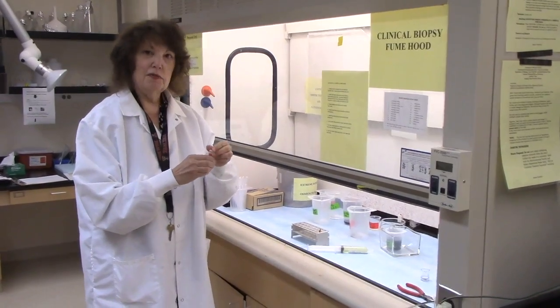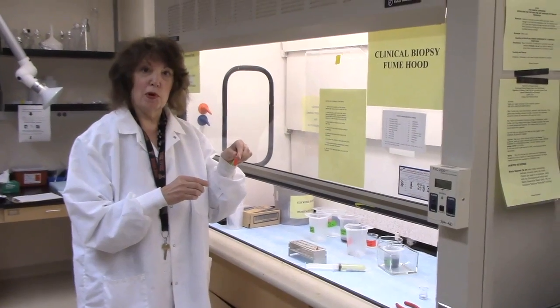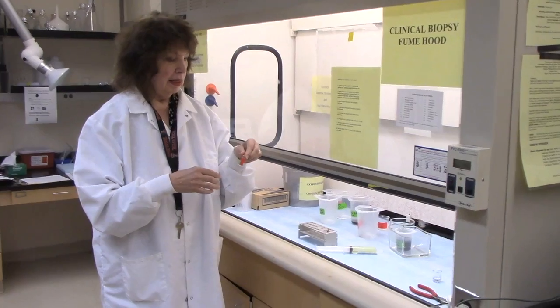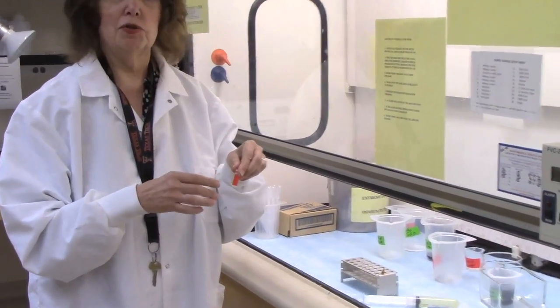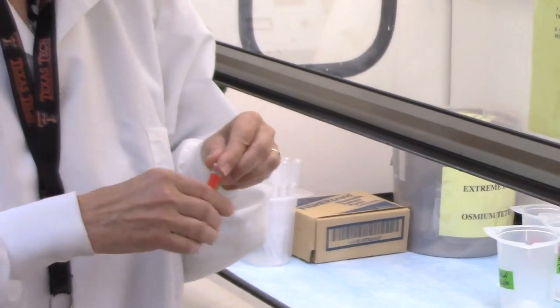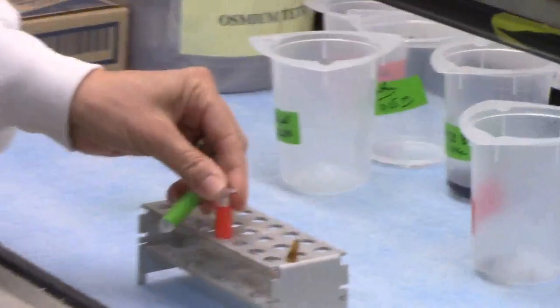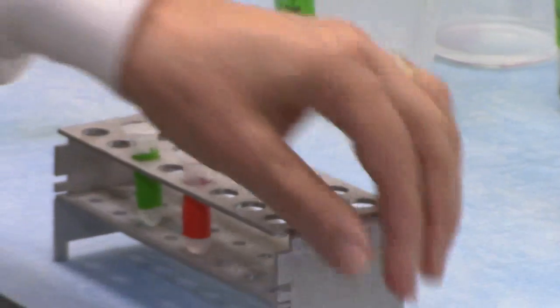I received two pellets of spores — one that had been in space and one that had not. They were labeled samples one and two, so I didn't know which one had been in space, and these samples were in a liquid medium.